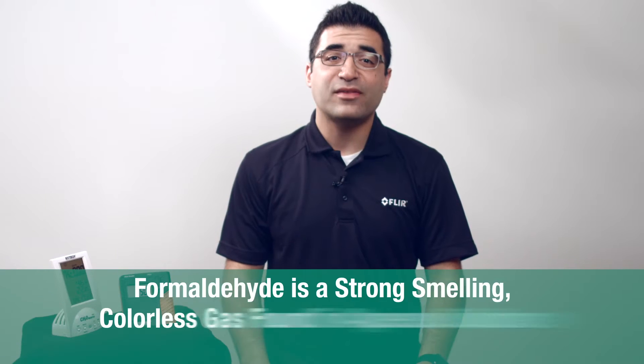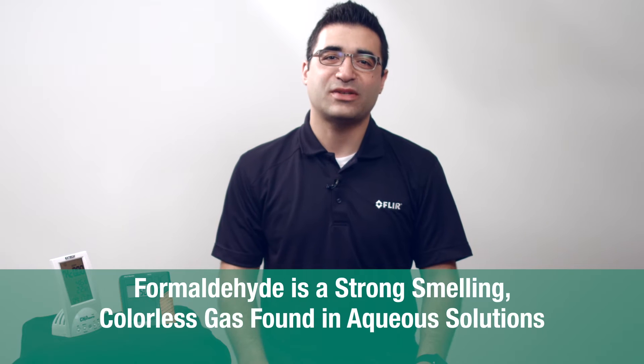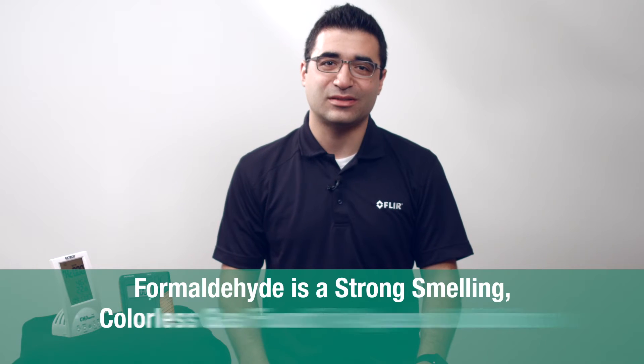Recently, formaldehyde has been a topic of conversation as high levels of it have been found in low quality lumber and building materials. Formaldehyde is a strong smelling, colorless gas found in aqueous solutions.